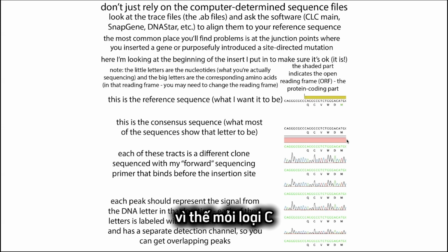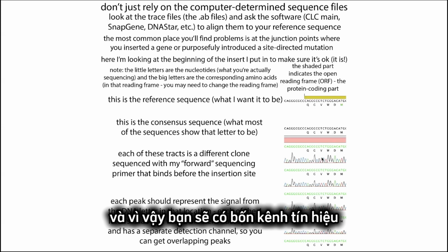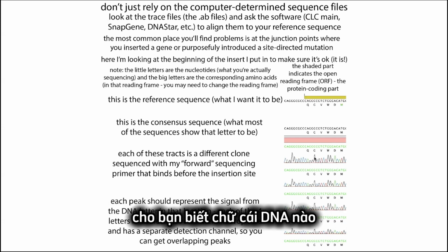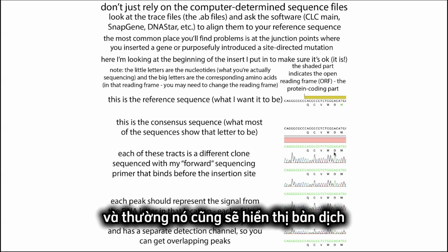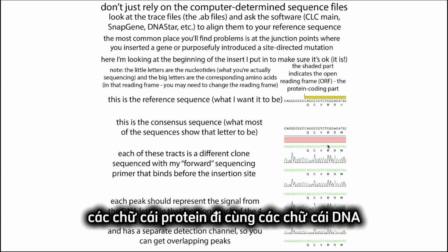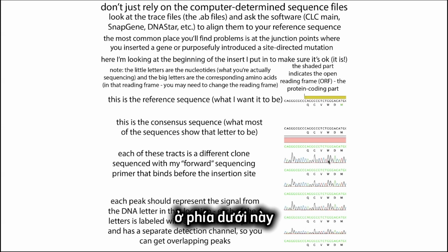And so each of them, the C, the T, the A, the G, they each had a different fluorophore. So you'll have 4 different channels, but they're going to be overlaid. And so you get this one overlapping trace where these different colors are going to be showing you which DNA letter was read at that position. Typically this is also written above in small letters, and often it'll show you the translated version, the protein letters that accompany the DNA letters. The DNA letters are being called based on the trace down here.